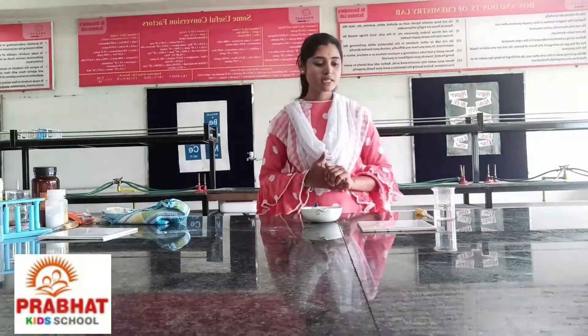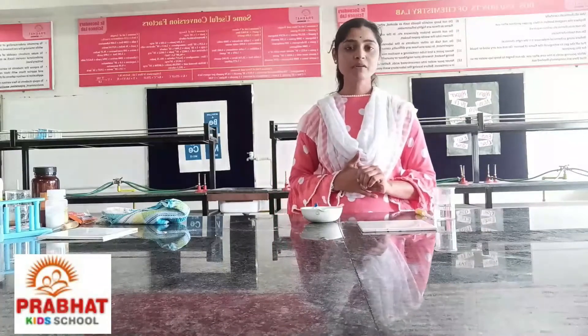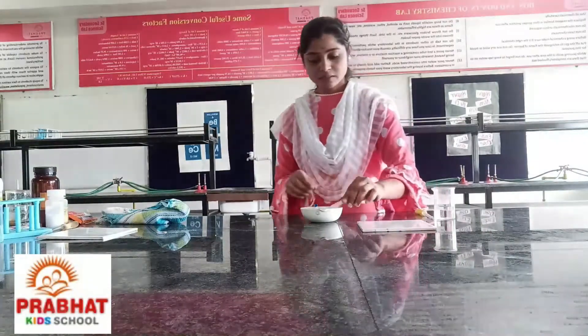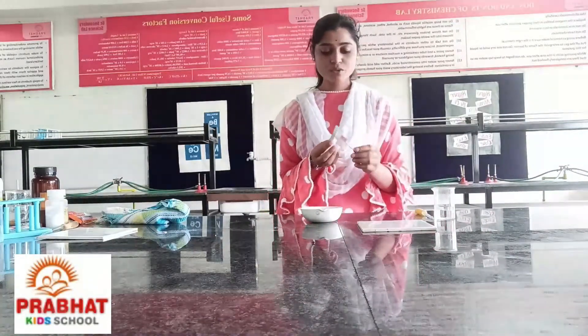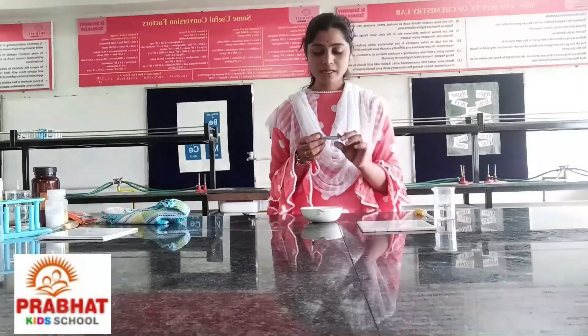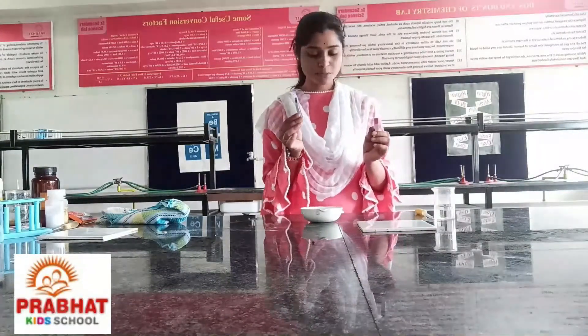Now, for this experiment, we require some material. For this experiment, we use the red litmus paper and this is the blue litmus paper.